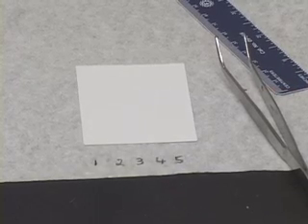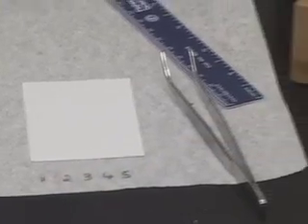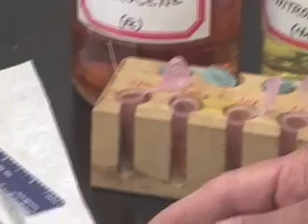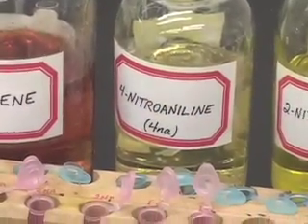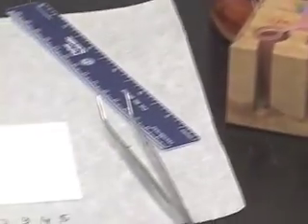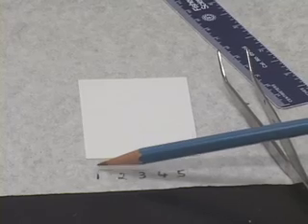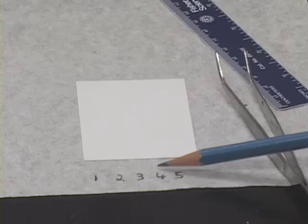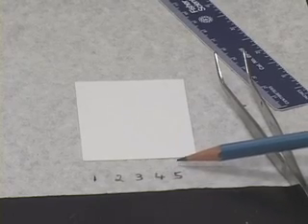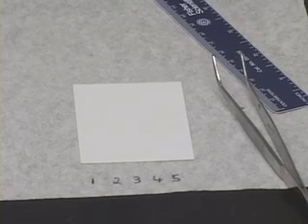So, in your book, if you want to make a table indicating that probably spot 1 would be due to ferrocene, spot 2 due to 4-nitroaniline, etc., it is a good idea to make a table like that. Or if you want to write the names of the standards right here on top of the numbers, that is also fine. So, see which way works for you and do it in that fashion.